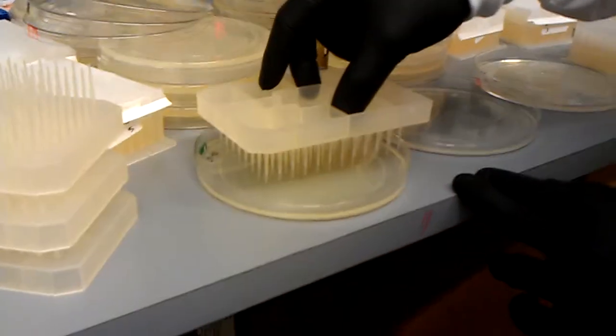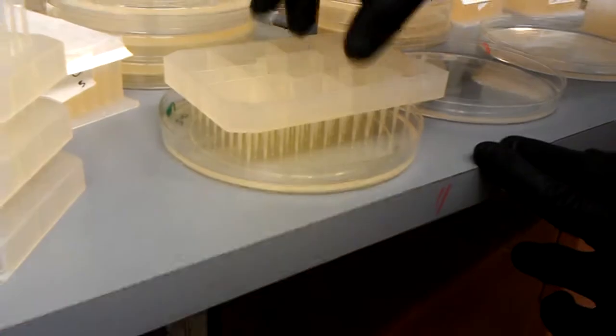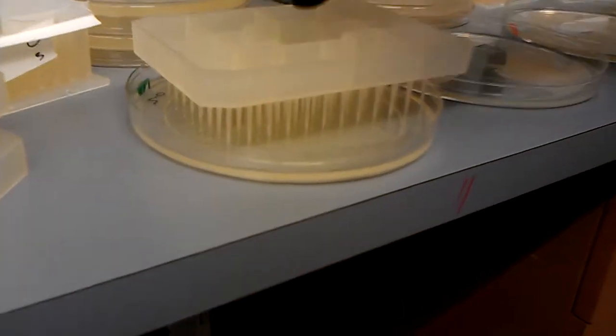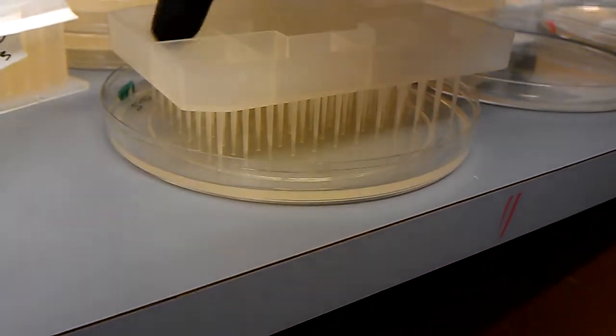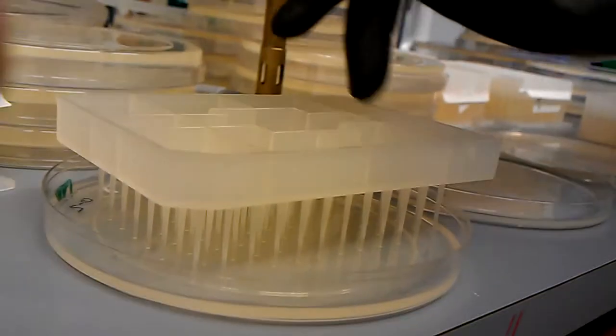And I just slowly release it and let the culture transfer from those tips to the LB agar. I'll press in the center and I'll press in the corners to make sure that the pin tool touches all parts of that plate.